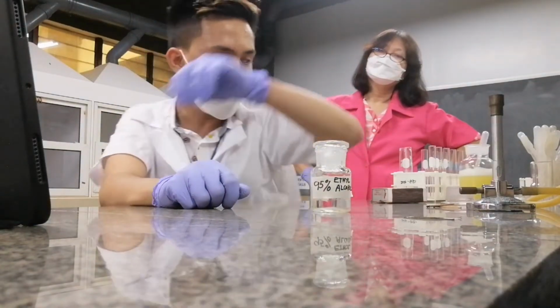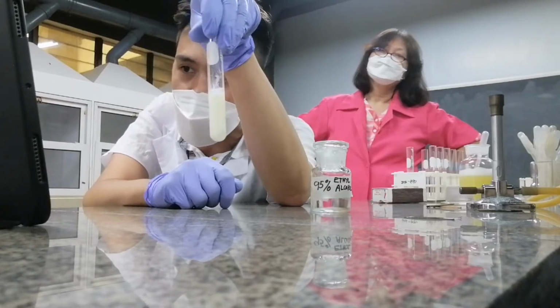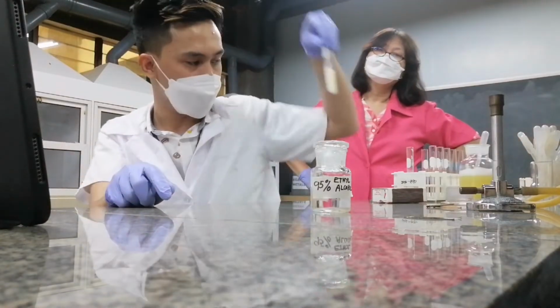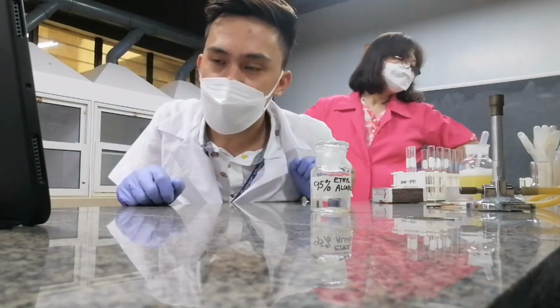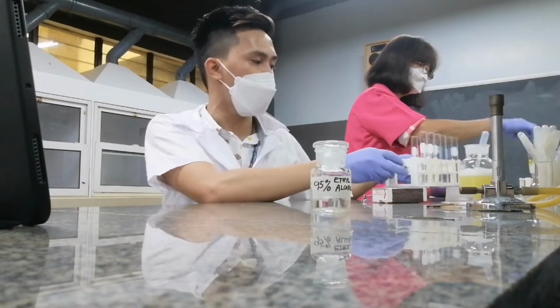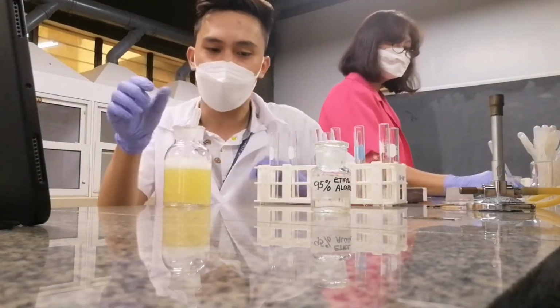Do you follow? So imagine, 95%? This is what happens to protein when you add 95% alcohol. It will harden. It can harden the tissue of your skin once you place very concentrated alcohol. Do you follow? Okay. So now, let's try another type, the precipitation of your albumin. Again, we'll be adding albumin here.